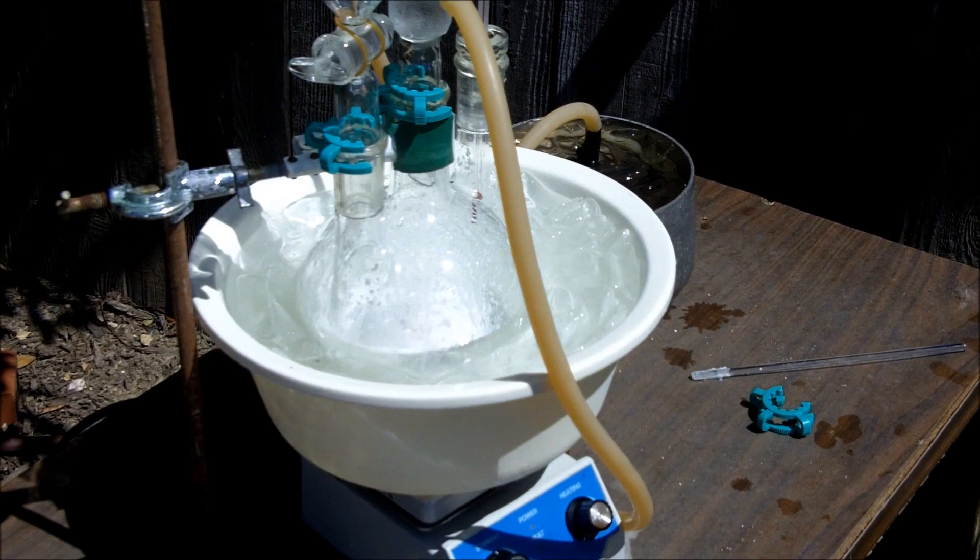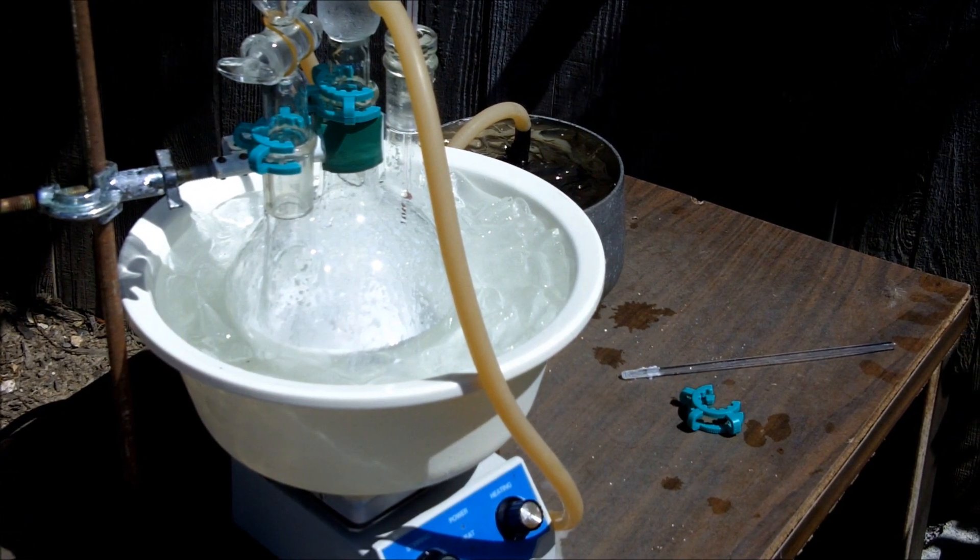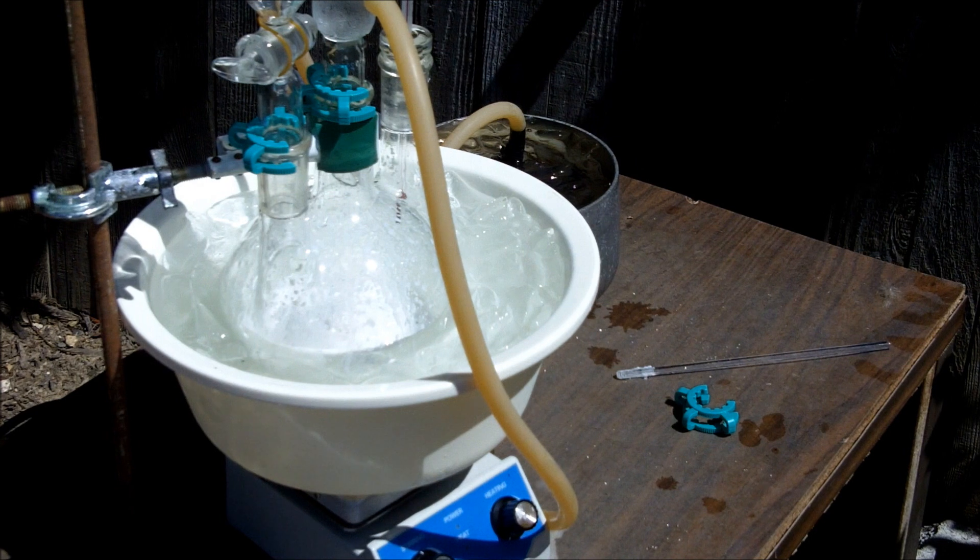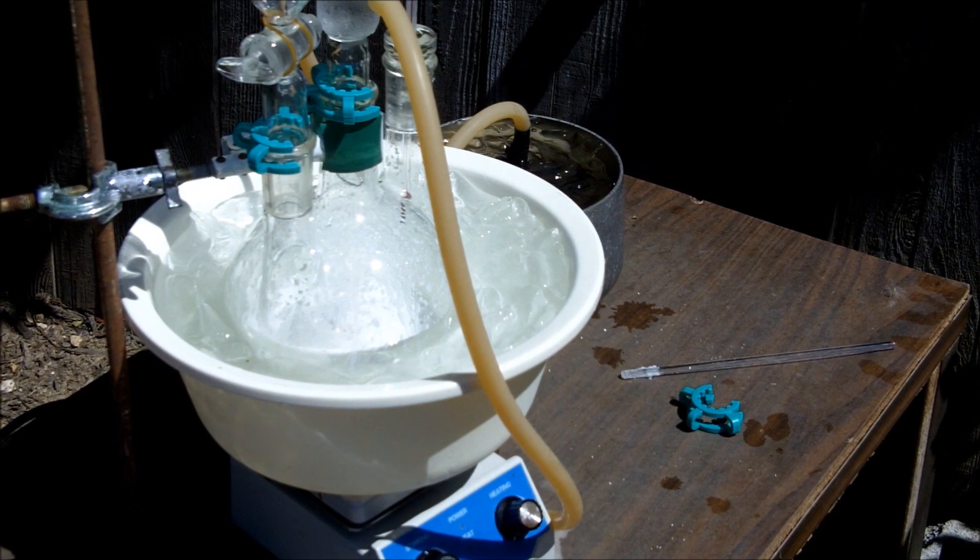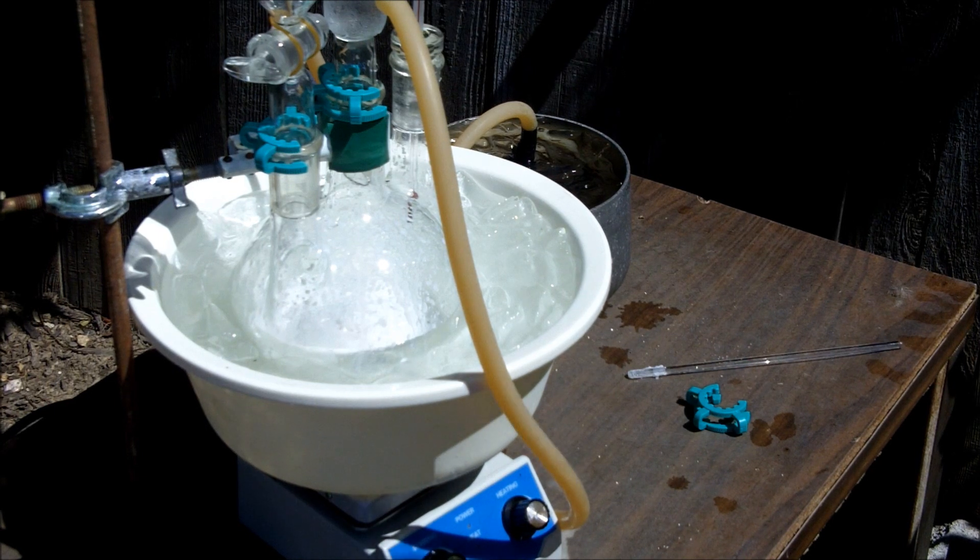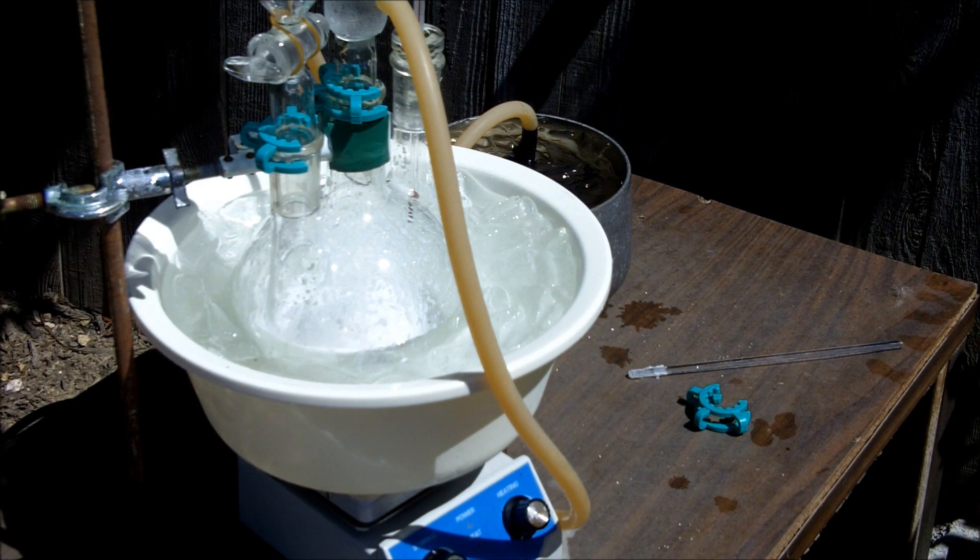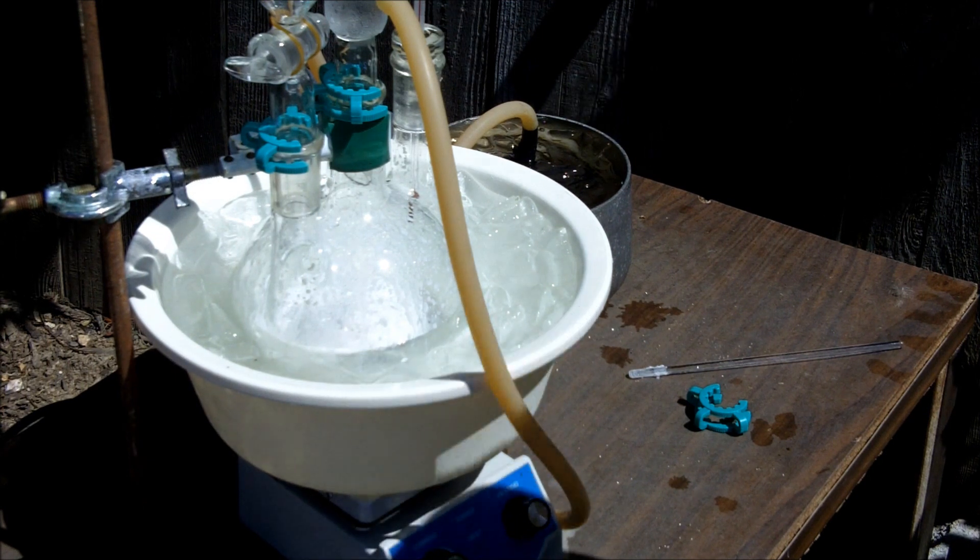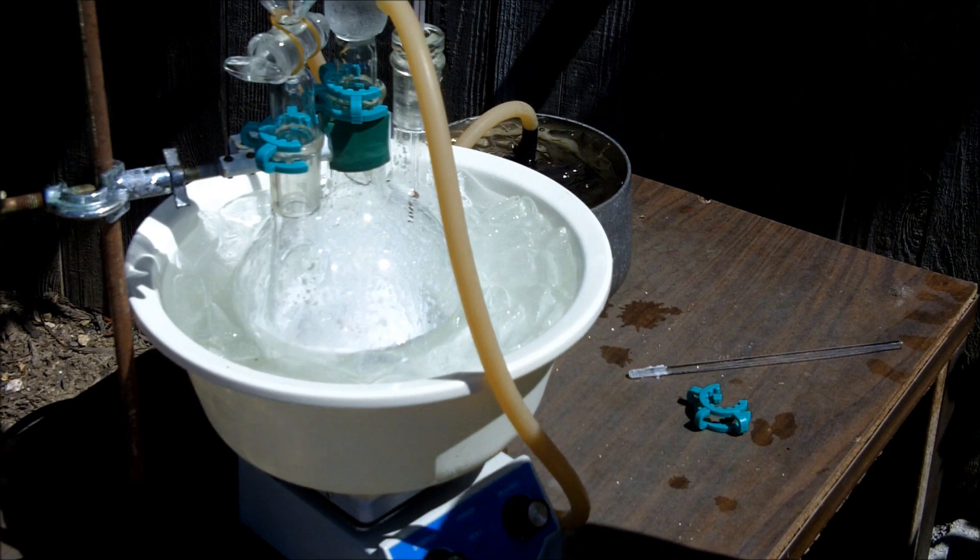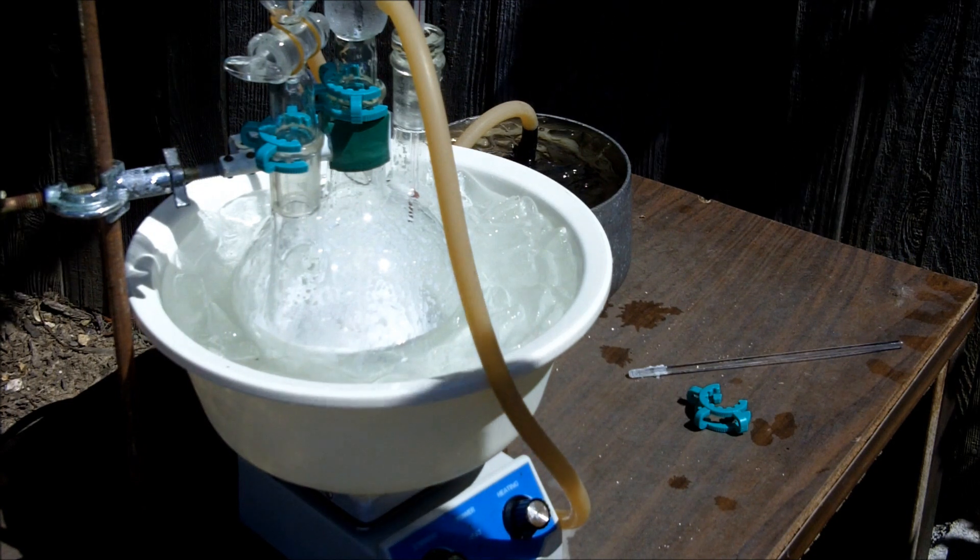I'm about 15 minutes into the synthesis and all the solution inside the round bottom flask has kind of clumped up and made this foamy mass in there. There's still definitely a reaction going on - you can kind of hear some off-gassing, and the temperature of the vapors above it has spiked to about 33 degrees Celsius.